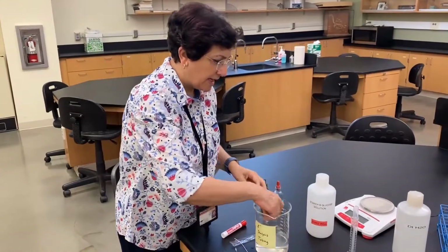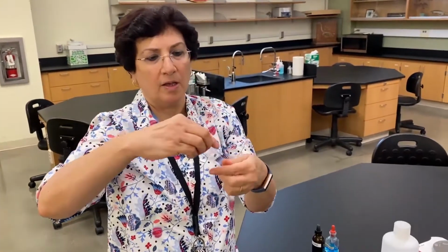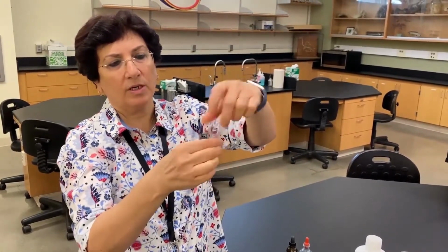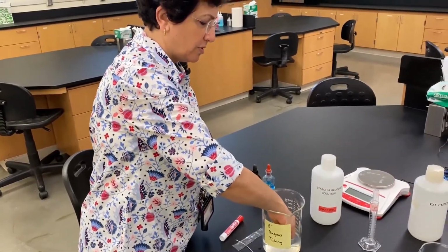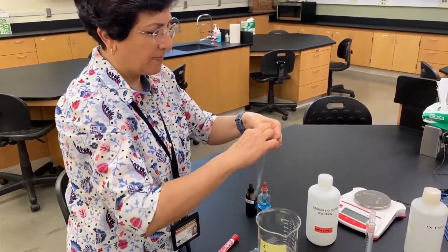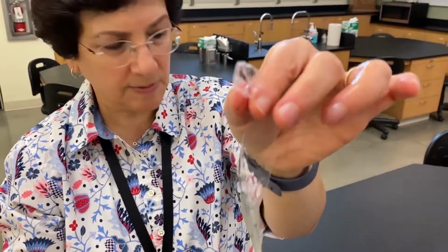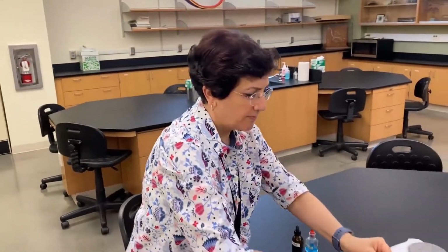How are we going to set this whole thing up? Again, we're going to take one of these dialysis tubes, the one we had soaked for a while. We will tie one end of the tube, and now we're going to put some of that starch glucose solution in. These tubes can be a little hard to open, so I just put it in water, like what you do with your grocery bags. Sometimes you need a little wetness to open them, so we're doing the same. And now my tube is open, so I can put my solution in it. Here is the solution, as I said, starch and glucose.